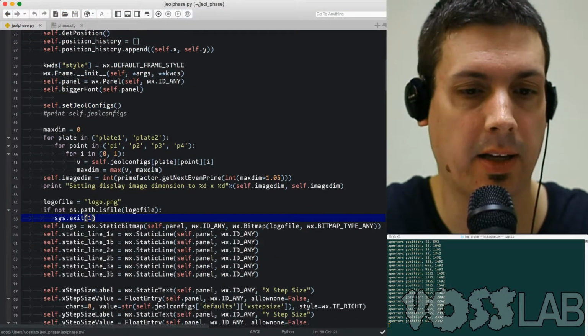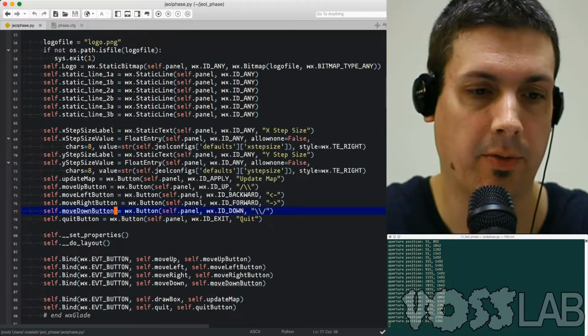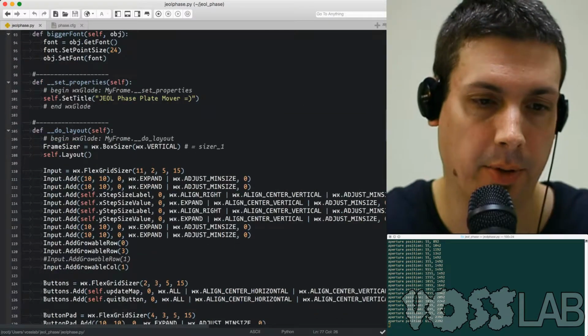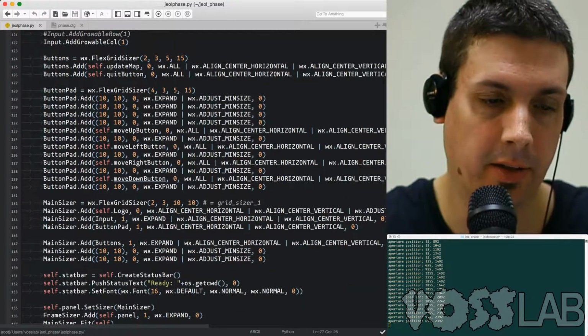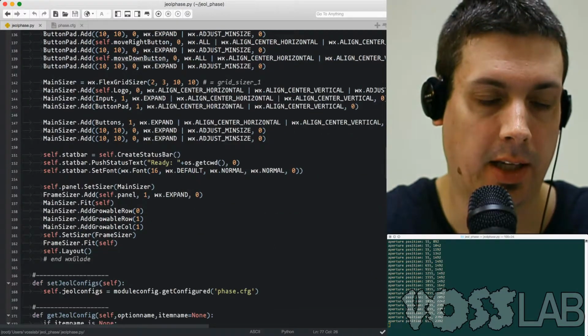Again, it cleaned it up a lot because I have a lot less buttons. X step size, Y step size, up, down, left, right buttons. Bind them to appropriate functions, and then I do the layout. I have the input section with the step sizes, the quit and the update map buttons, the button pad, and then I merge them all together in the main sizer, create a status bar, and fit things together.